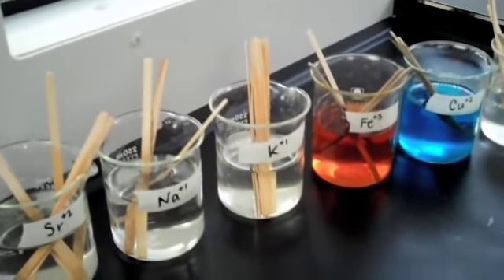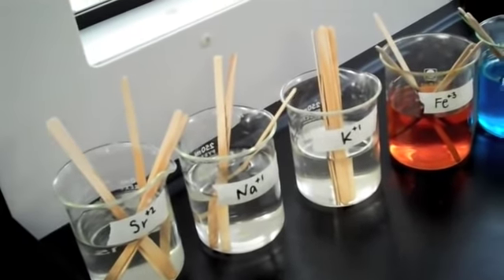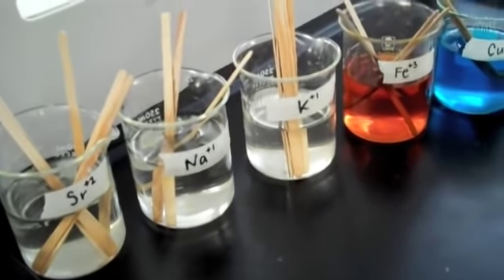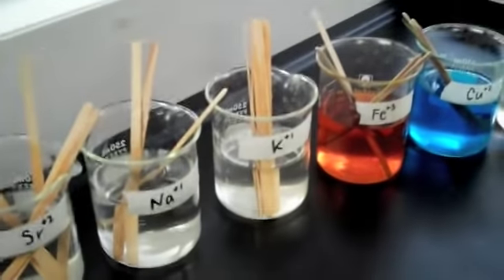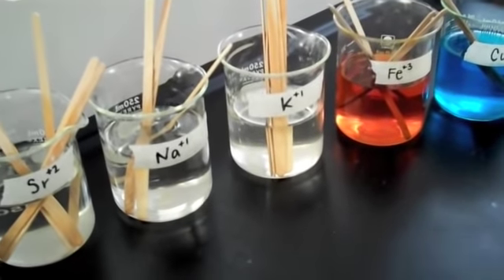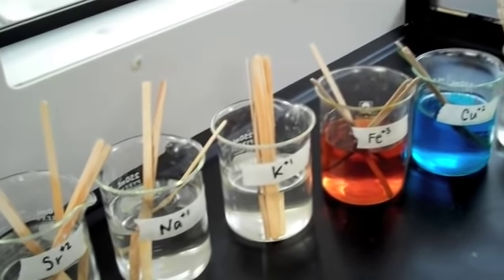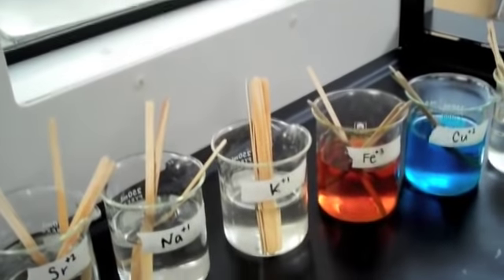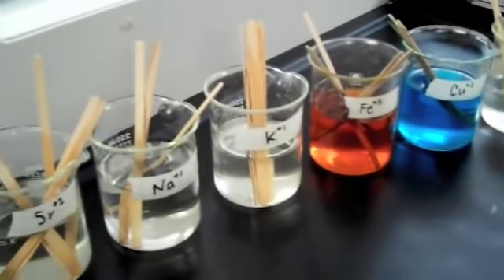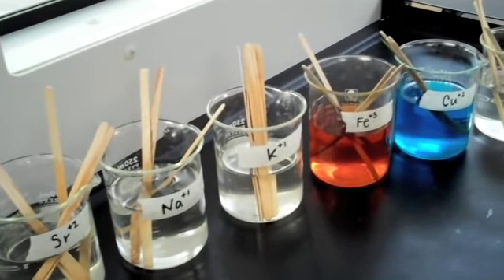For the final question, I want you to design a firework that changes from green to red as it bursts. Which atoms would you use and in which sequence? Refer back to your data table for help. This is the conclusion of the lab. At this point, students could return their goggles to their proper storage location, be sure their stations are cleaned up, and submit their work.